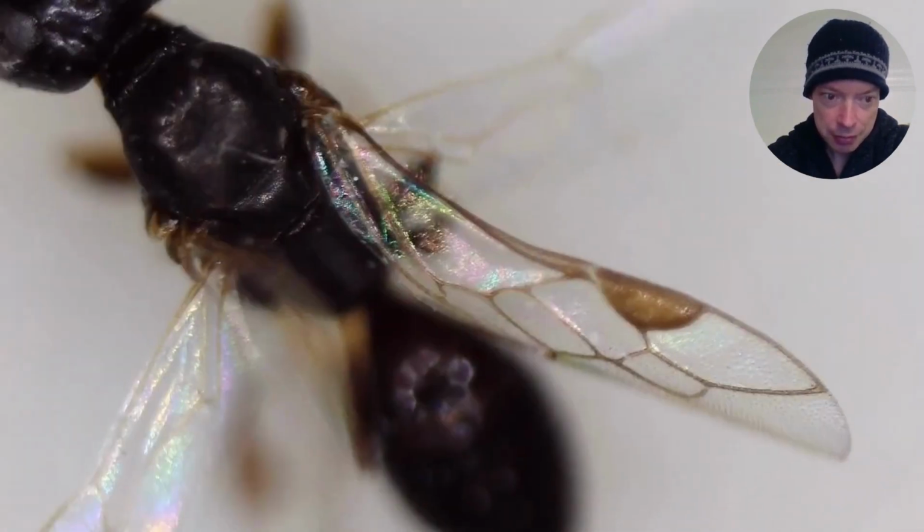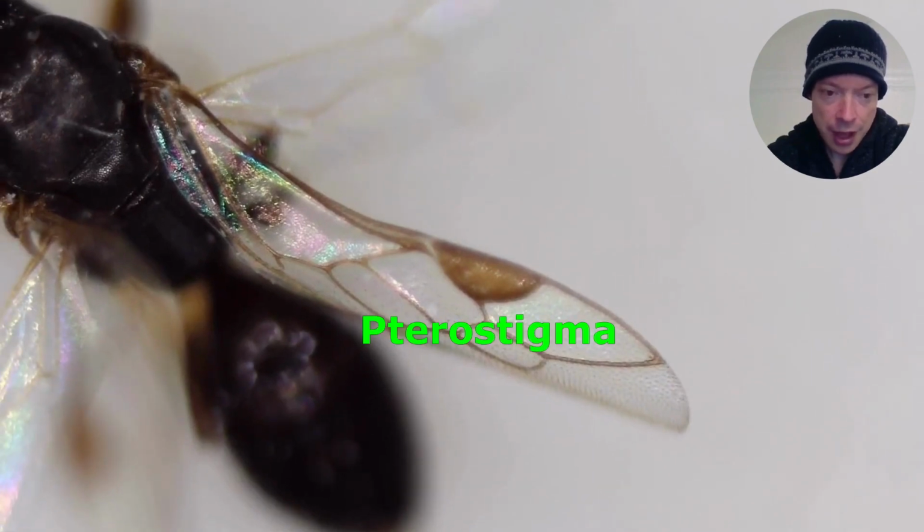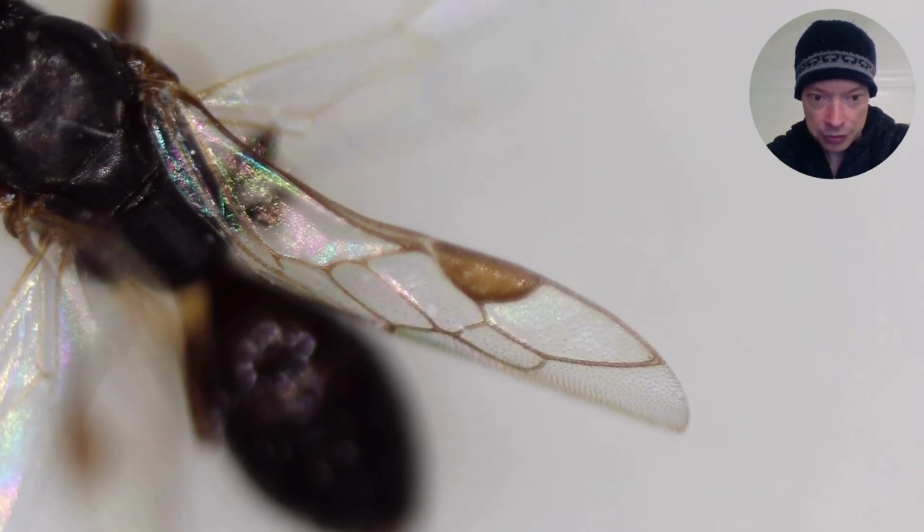And the pterostigma is heavier than the rest of the wing, and it helps insects to hover and glide in the air. Dragonflies also have the pterostigma, and it is on both wings in dragonflies. But as far as wasps are concerned, they have the pterostigma on the forewings, so the hind wings don't have the pterostigma.